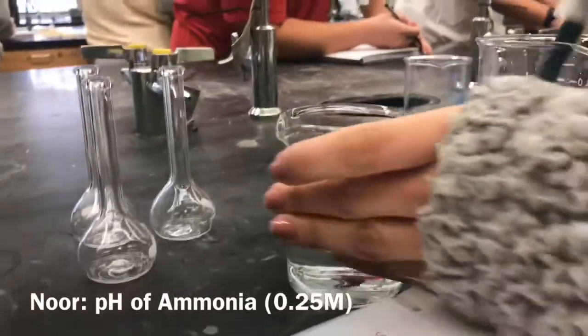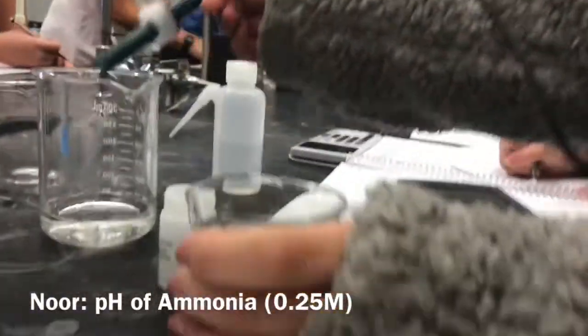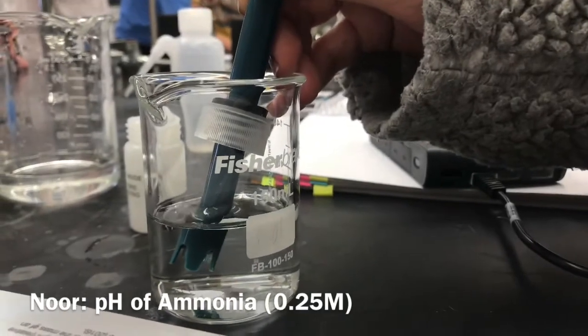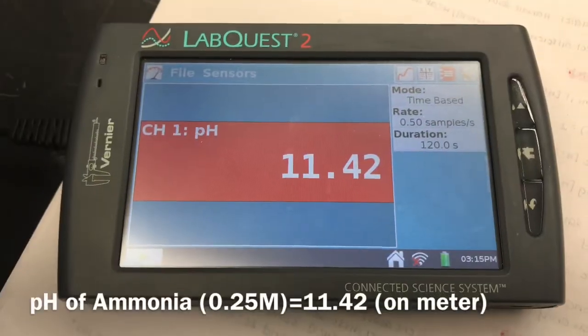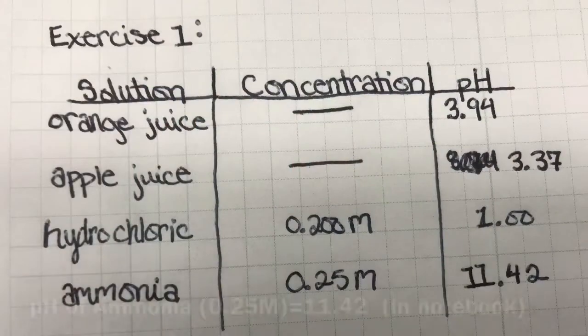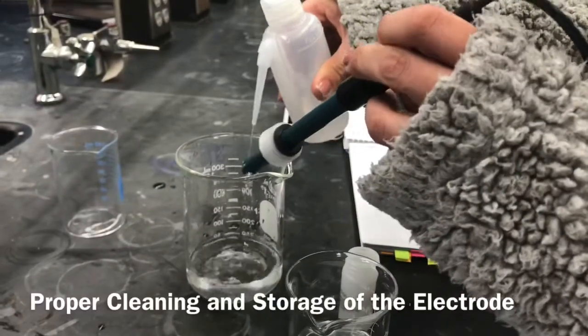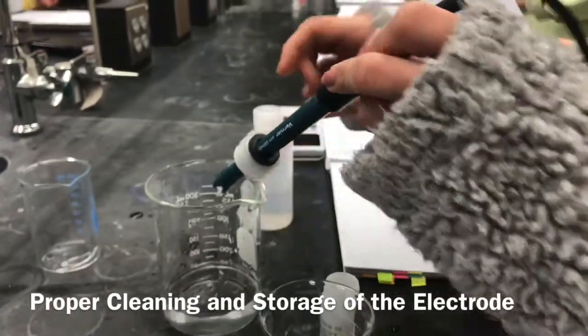Finally, we use the pH meter to determine the pH of ammonia, which has a concentration of 0.25 molarity. We first rinse the electrode, then immerse it in the ammonia. Then, we wait for the pH to steady out and record the value in our notebook. We then properly rinse and store the electrode for later use.